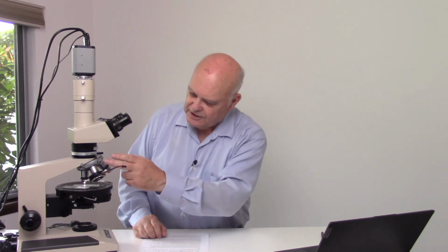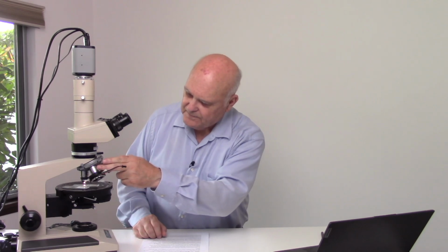Manufacturer helps us with part of that. The microscope is designed so that the objectives and the eyepiece are in the correct position in order to give us the ability to focus on a particle on the stage of the microscope. If we take a look at the stage of the microscope, we can use the coarse and fine focus to focus on the particles of interest.